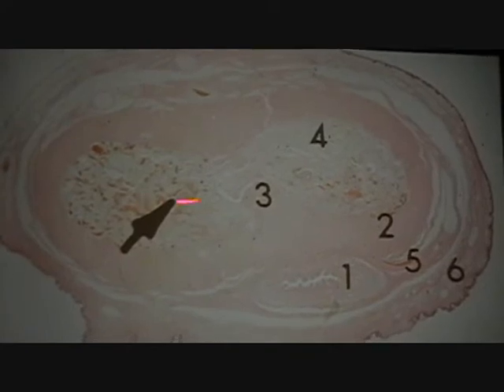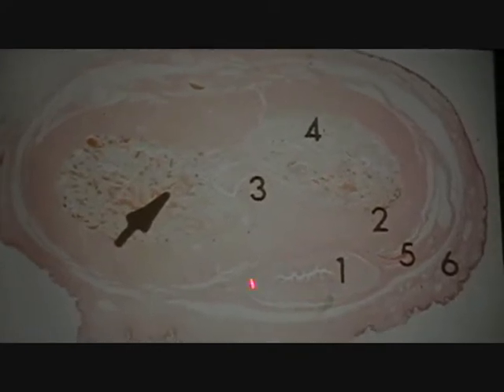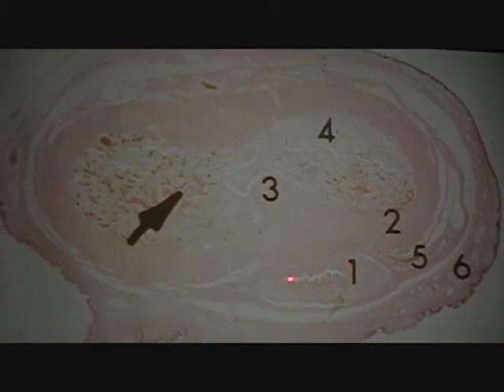Sort of a counterweight to the cavernosus, where the spongiosum ensures that the urethra stays open, or patent, at all times. It's the figure 8 that tips you off. And then the cavernosus, spongiosum, urethra. All you need for that histological section.